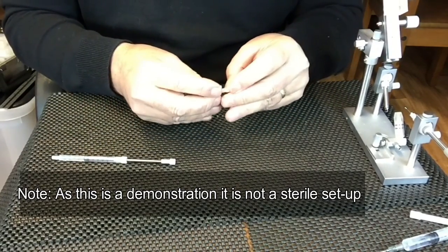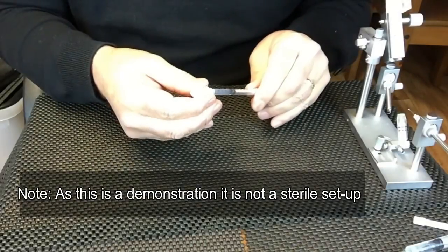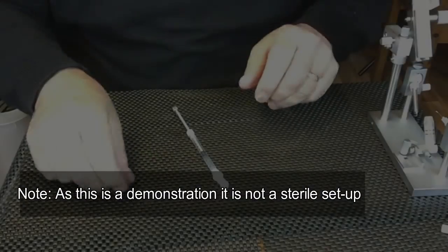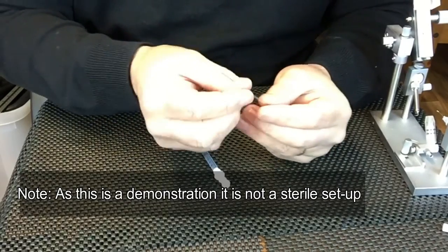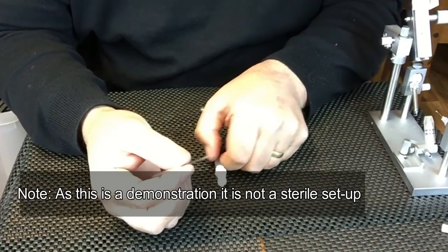They fit together and fit onto the end of the syringe. You can then use one of the long glass tips.